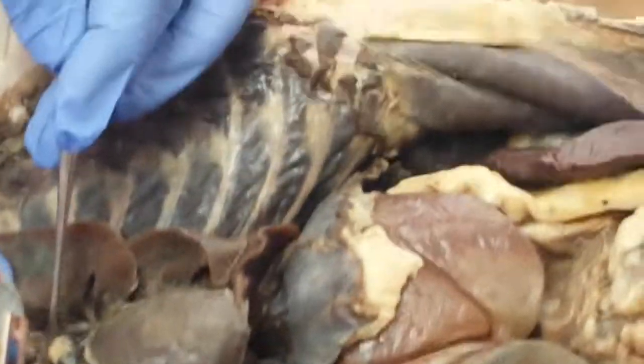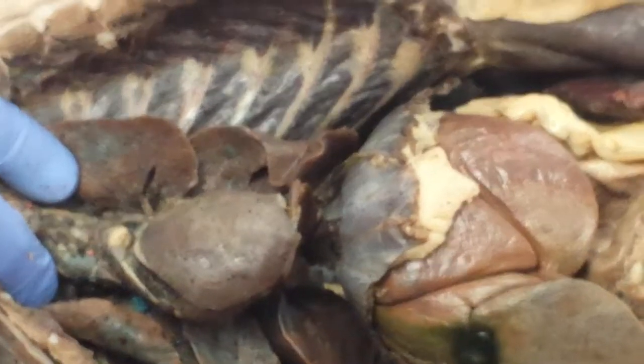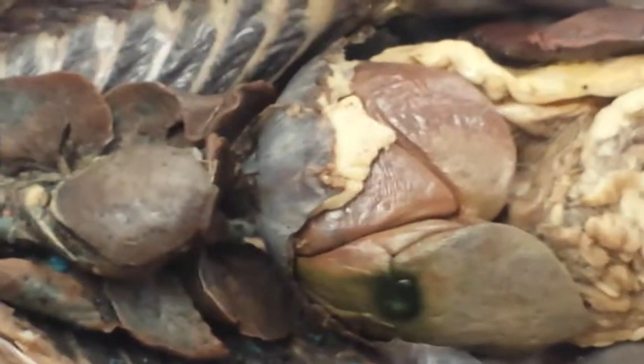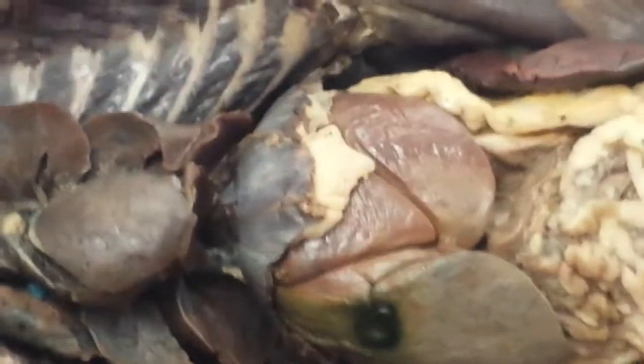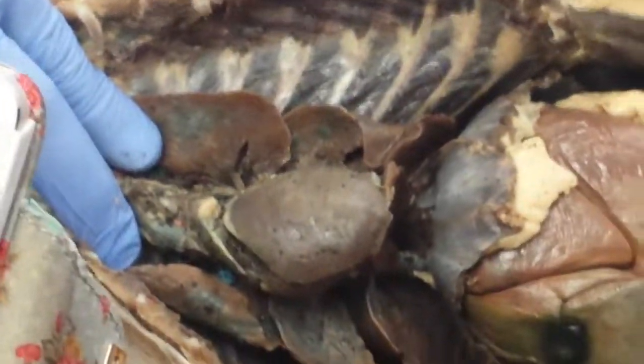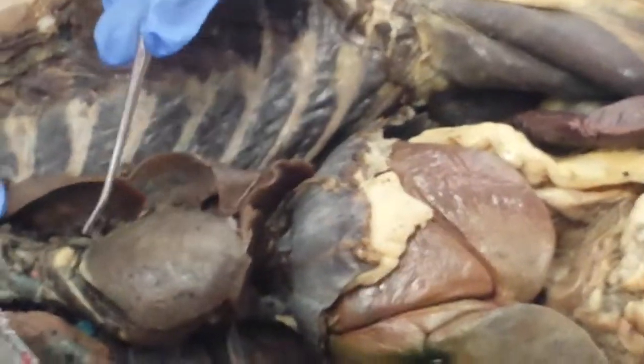Remember the fat tag I always told you about? The aorta. Look for the little fat tag. That's the aorta. But remember in the heart anatomy, the aorta is not the most anterior major vessel on the base of the heart. What is the most anterior trunk leaving the heart? Pulmonary artery or pulmonary trunk. Remember, pulmonary artery carries what kind of blood? Deoxygenated blood.